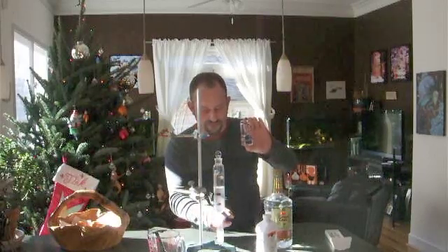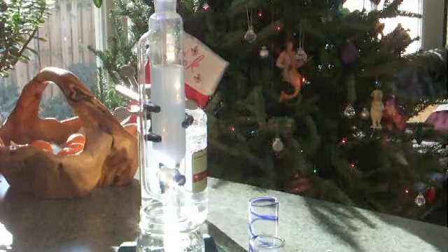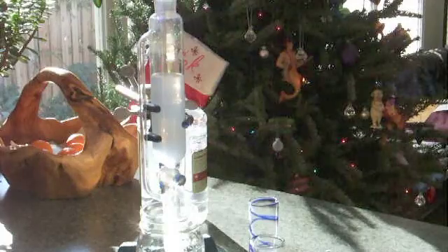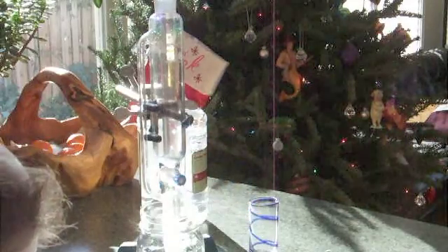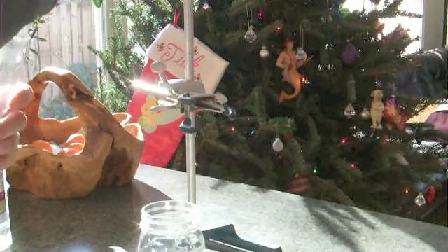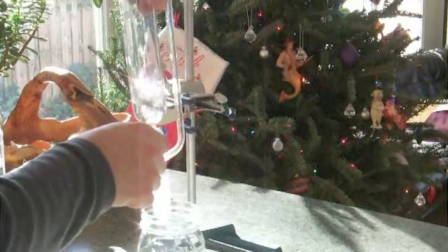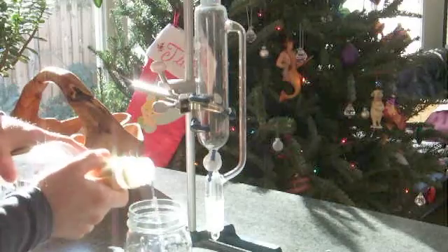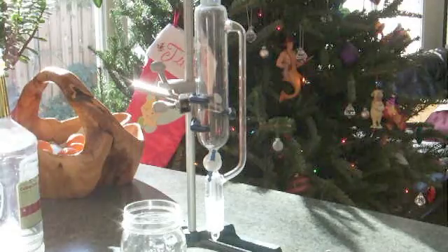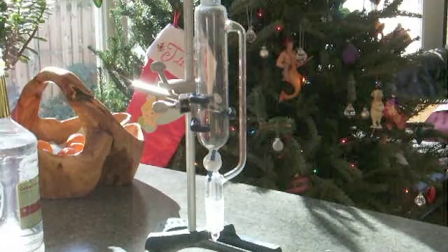To test it out, I poured a little bit out of the bottom through this valve here and added a teaspoonful of alcohol — and sure enough, we get a clear liquid. I think that's what I'm going to do with this. There you go — we have geranium oil in an alcohol-water solution.